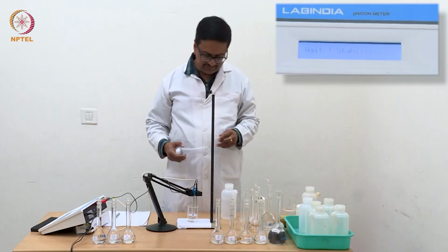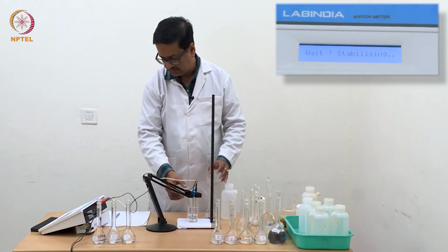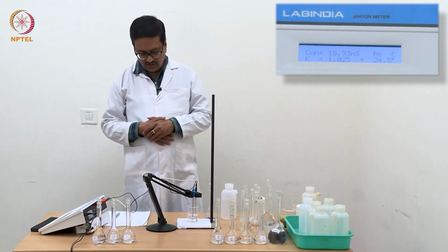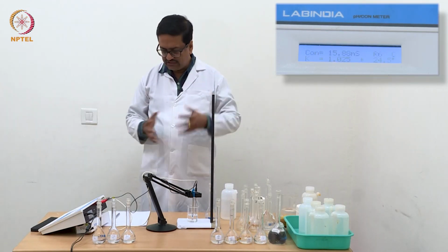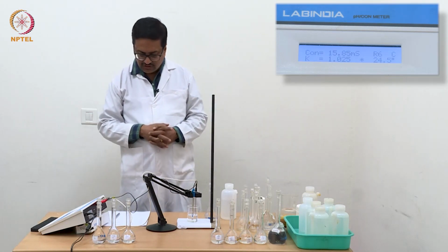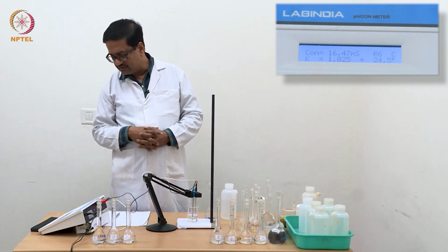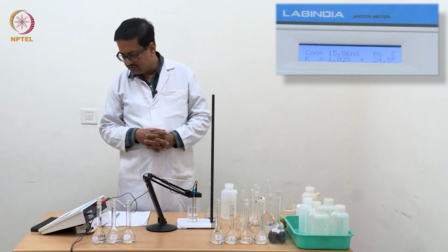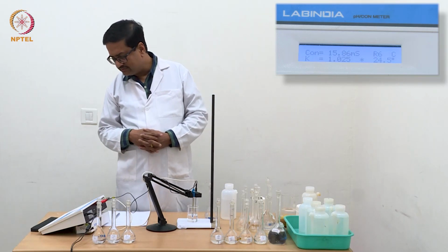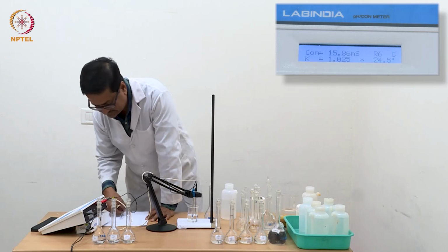And now I have added N by 32 HCl. It should read maybe nearly double of what we had seen before. It was 7.7 and now it is about 16.5, 15.8, and it is stabilizing at 15.86.